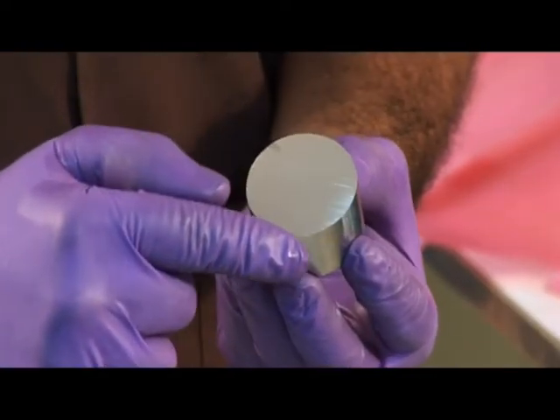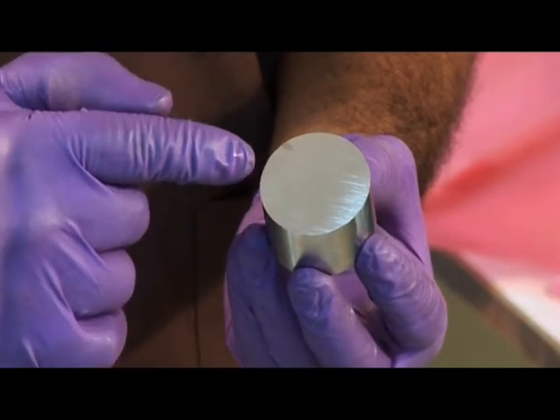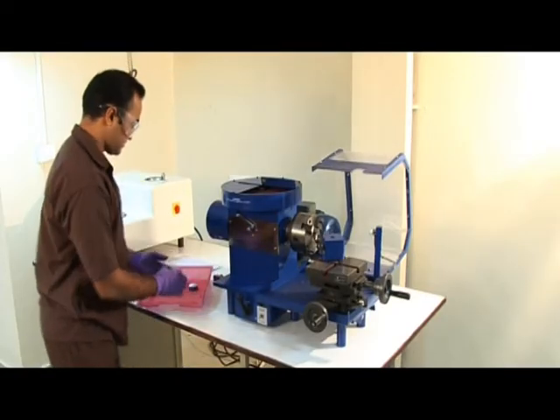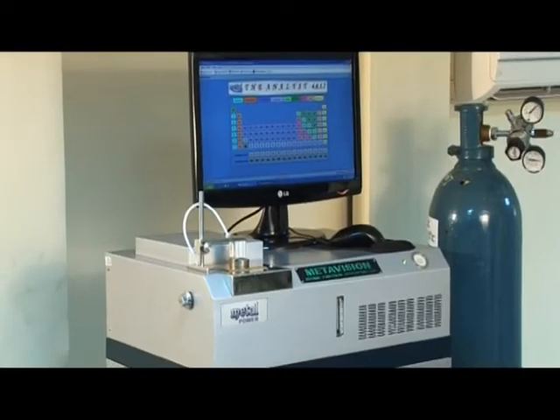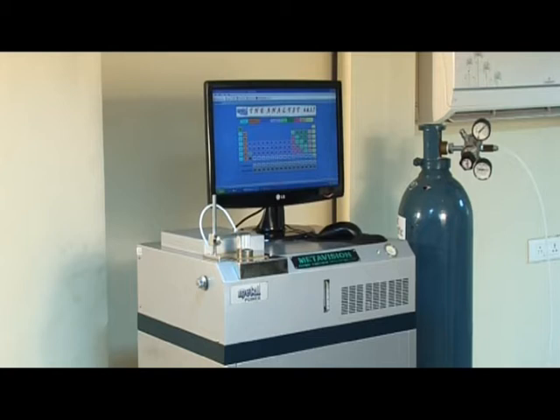Ensure that the sample surface is not touched or dirtied in any way. The analysis is recommended to be carried out soon after sample preparation. This spectrometer is pre-calibrated, re-standardized, and ready for analysis.